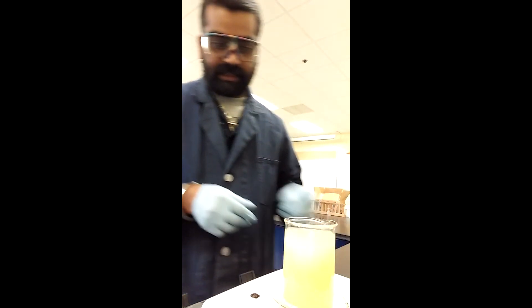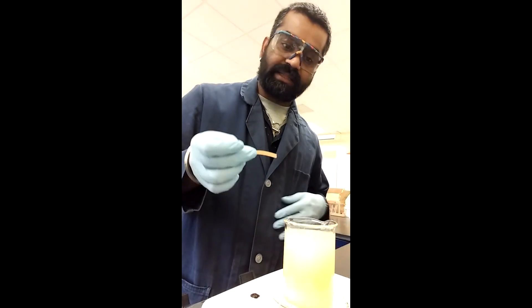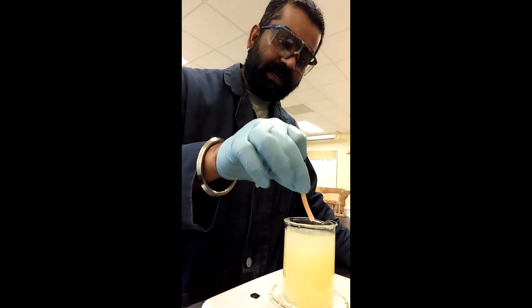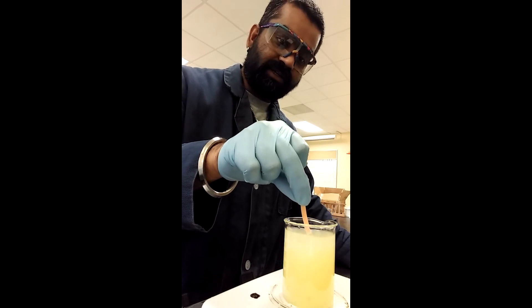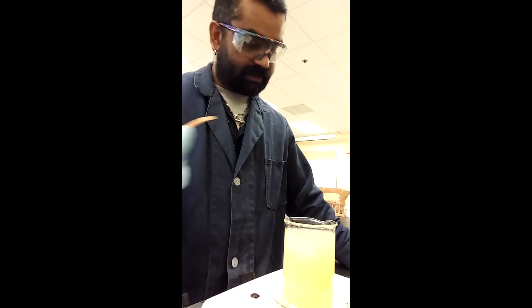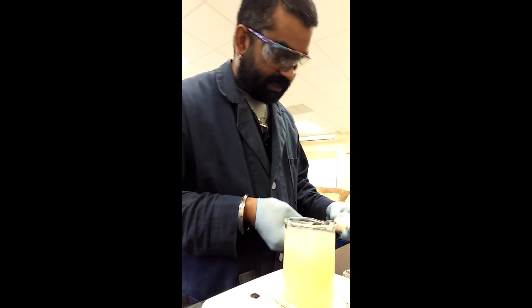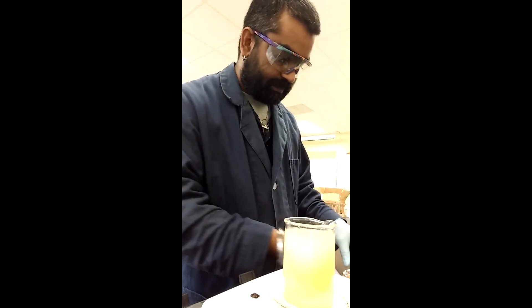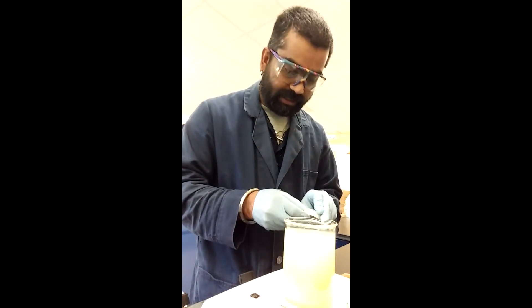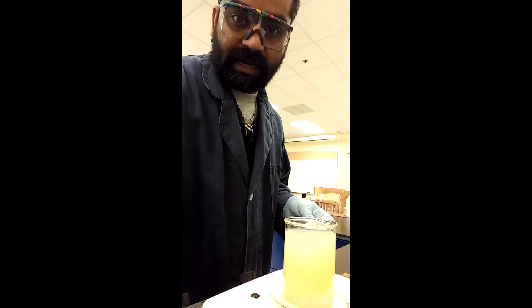You'll see nothing happens until we hit about pH 9 — that's when you'll start to see something separate out, and we're actually looking for the filtrate. I'm going to dip the pH paper in — nothing is happening yet, which means we're still in a lower pH range. I'll probably turn it off here and come back.